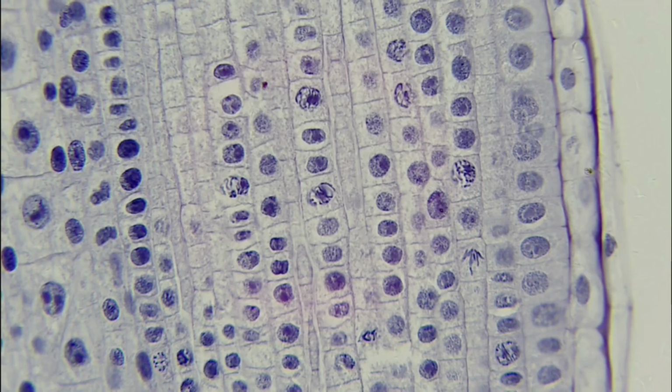It's also important to note the different stages of DNA because that's one of the terms I'm going to use as we talk about mitosis. Chromatin is DNA in its loose active form, and that's really going to be during interphase and the last part of telophase. We are also going to see DNA condense into what people typically recognize, that classic X shape or the chromosome. That is basically during prophase and metaphase. And then we're going to have our chromatids or our sister chromatids. That is really going to be in anaphase and the first bit of telophase. And we'll go through that more later.